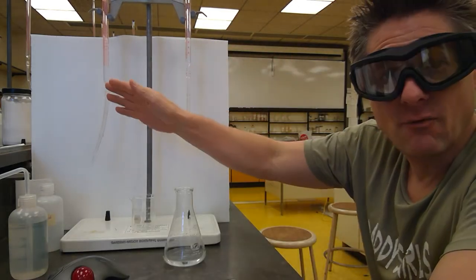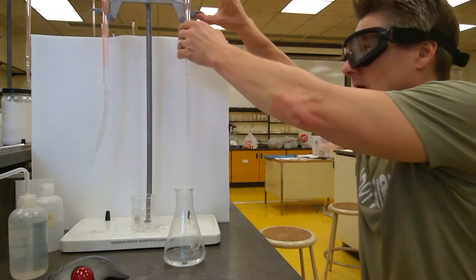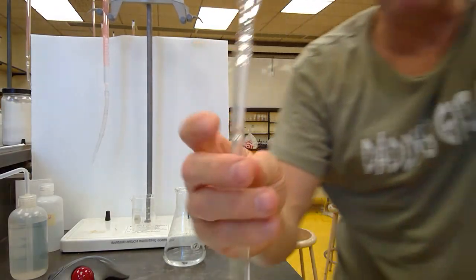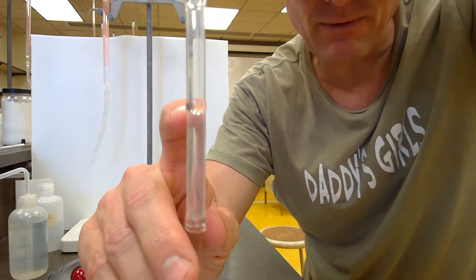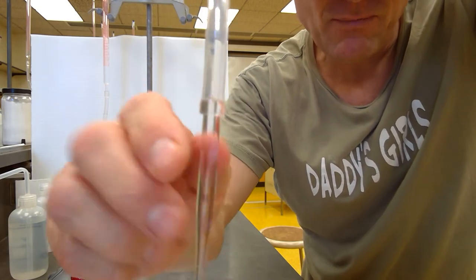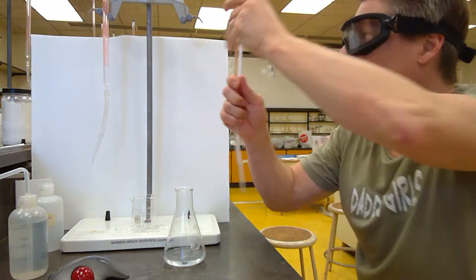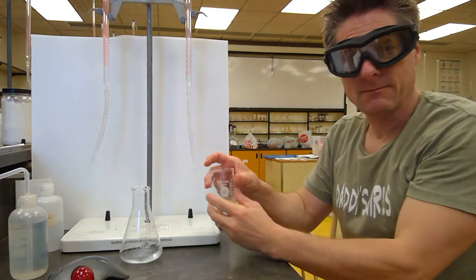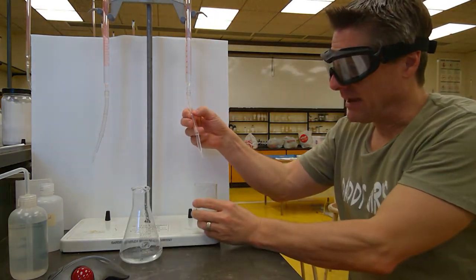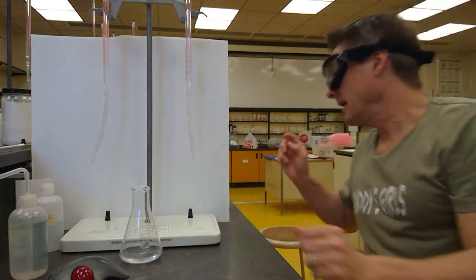I've already conditioned these four times, made sure there's no bubbles at the tips here, right? So you always want to take a look here and go, okay, I've got no bubbles or air gaps above the bead in my Mohr burette, no bubbles below, and I'm nice and flush at the tip. See that? There's no air gap at the tip. If there is an air gap at the tip, you just get a waste beaker and get a little drop hanging off, tap it off in the waste beaker, and you're good to go.